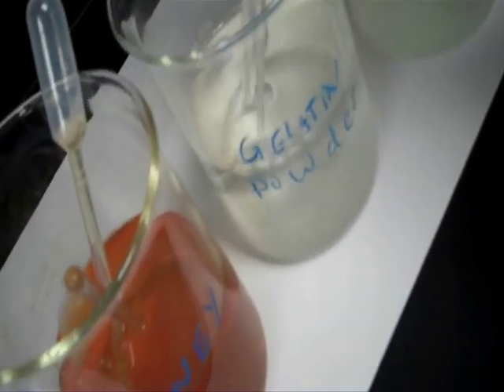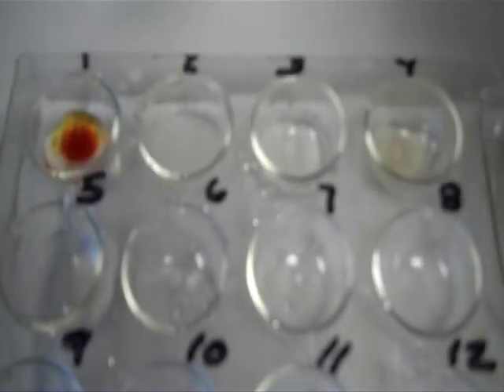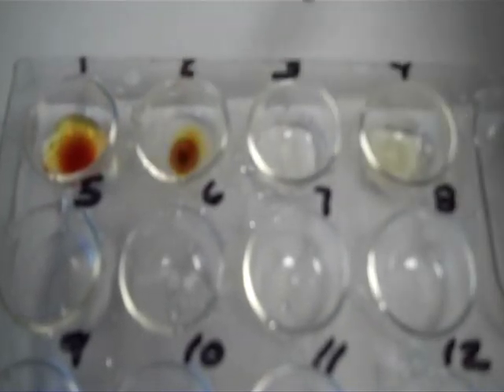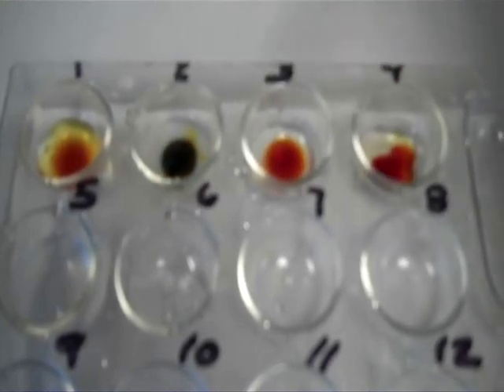We're going to put table sugar in number three, glucose or honey in number four, gelatin powder in number five, and egg white into number six. Now we're just going to add iodine to each of the wells. Iodine turns starch a blue-black color, so we're looking for black — that will be a positive result for starch.